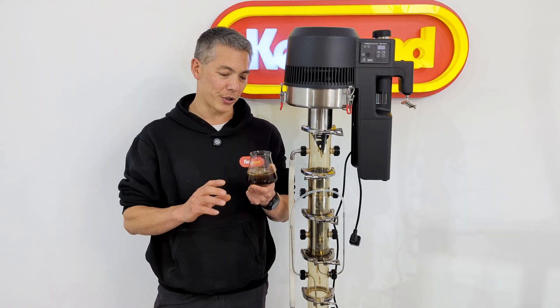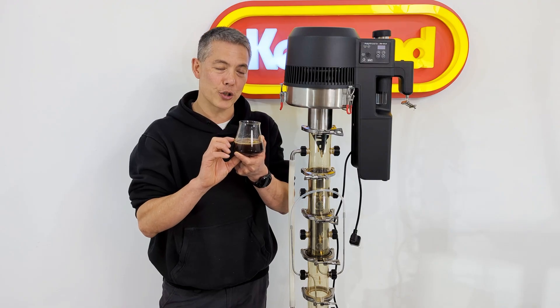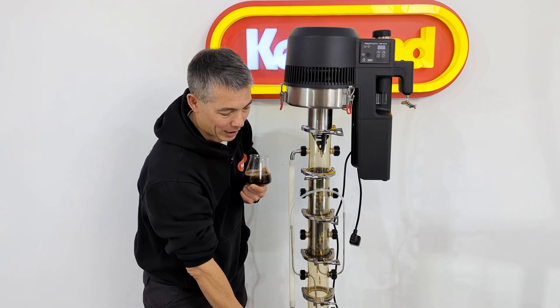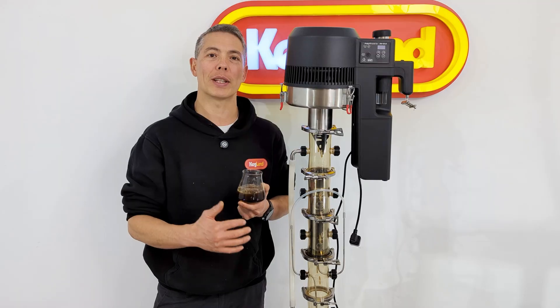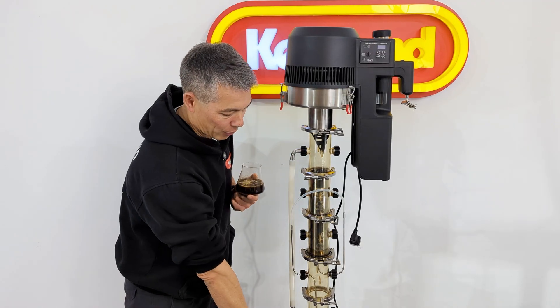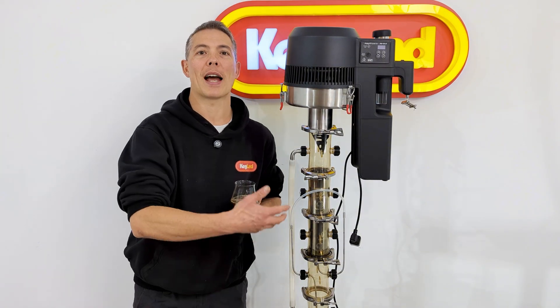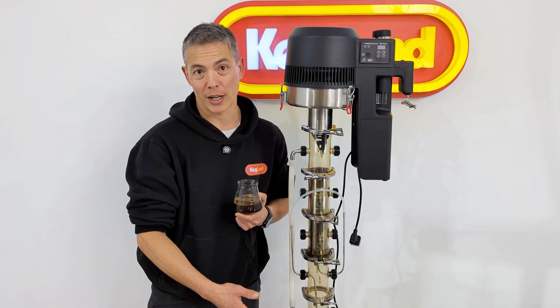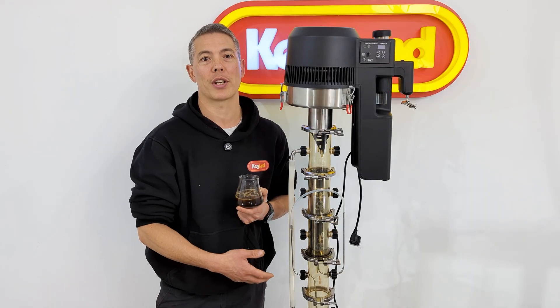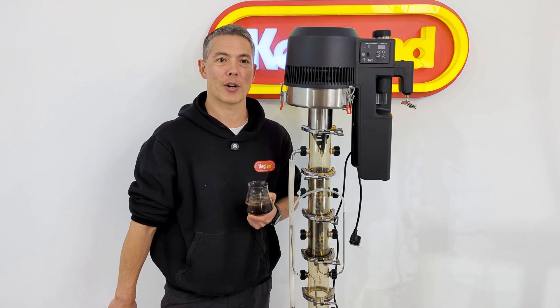This is probably a little bit watered down due to the amount of alcohol I had in the boiler. But one other thing you can do at the end of the Soxhlet distillation process is once you've got all those flavours and alcohol in the boiler, you can boil some of the alcohol off to make it more concentrated. That's also a fairly fast process if you wanted to make this tincture even more concentrated.